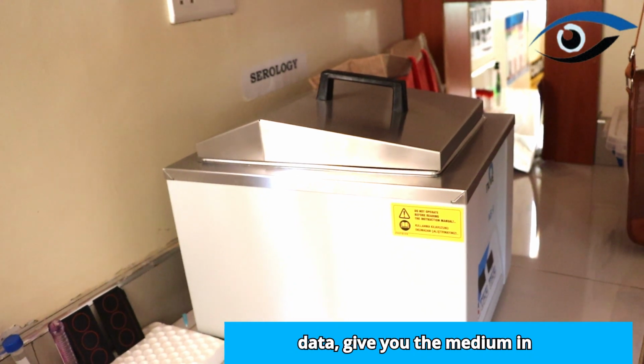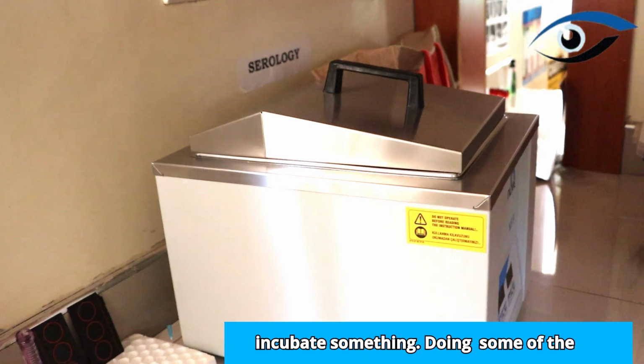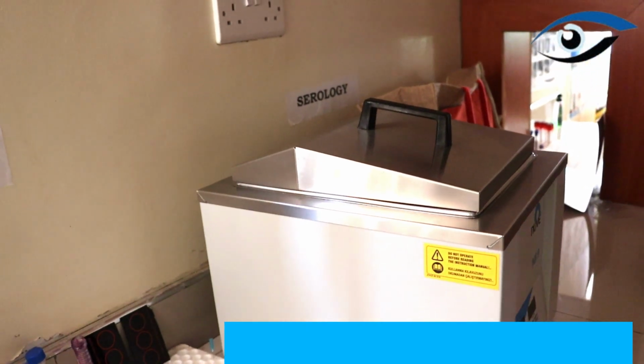Apart from that, the machine here, this one is a water bath. It gives you the medium in which you're supposed to incubate something. It's used for some of the tests, like the DU test, to rule out if the client's result is negative or positive.